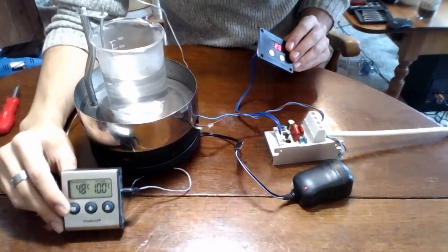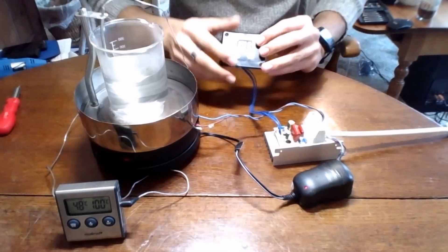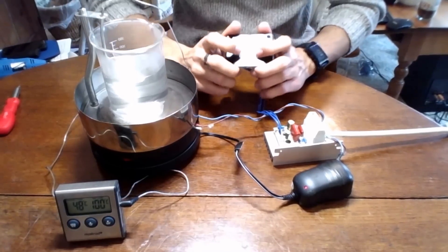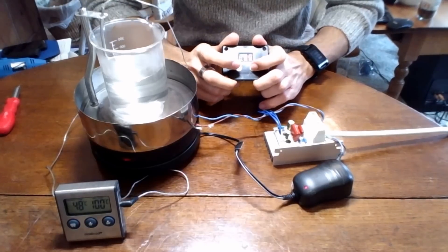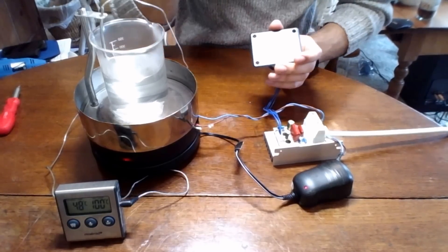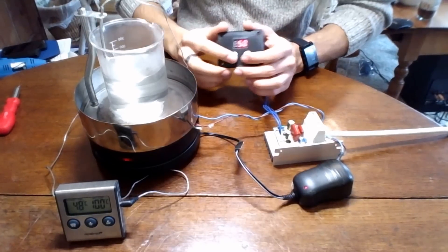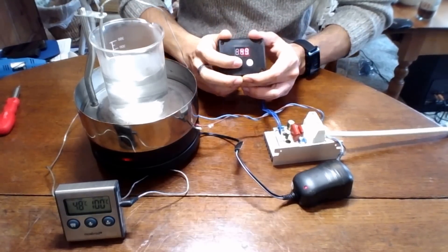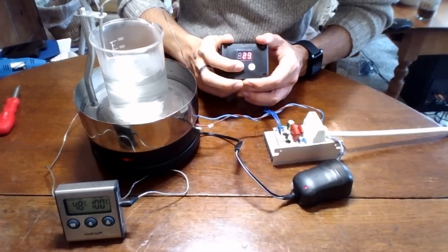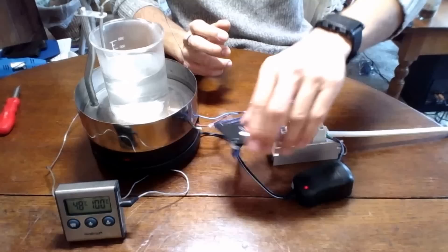Here, our element is heating up slowly. But we'll take it up to 50% throughput, just to see how much faster it heats up. I won't take it all the way up to 100% because I don't want my water to start boiling with all these electrical elements around. So at 50%, you can see it heats up quite a lot faster. We'll leave it at 20 for now.